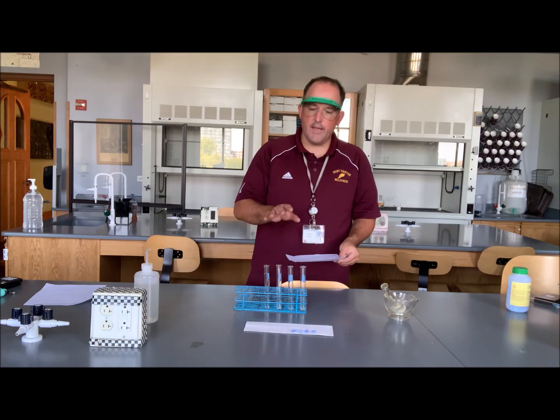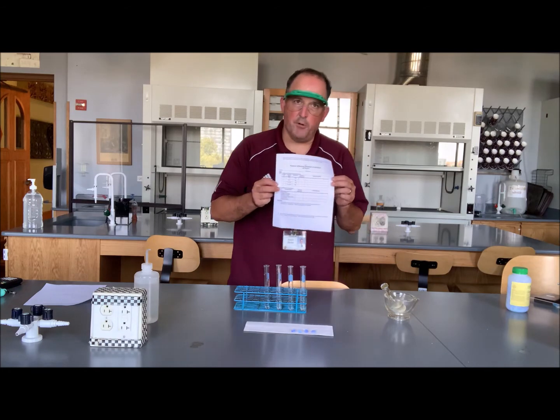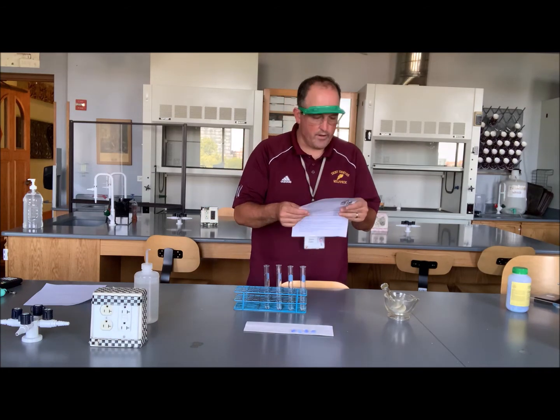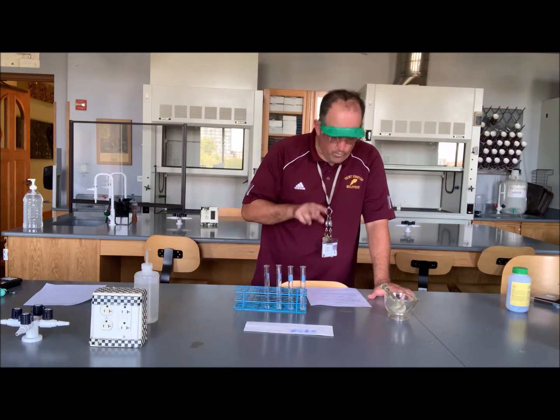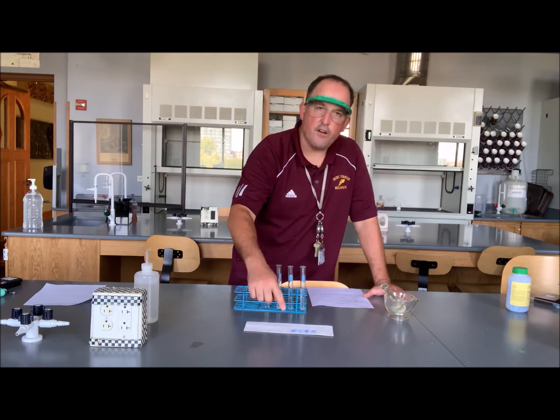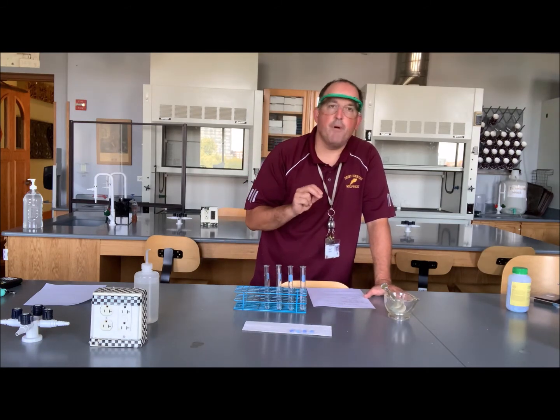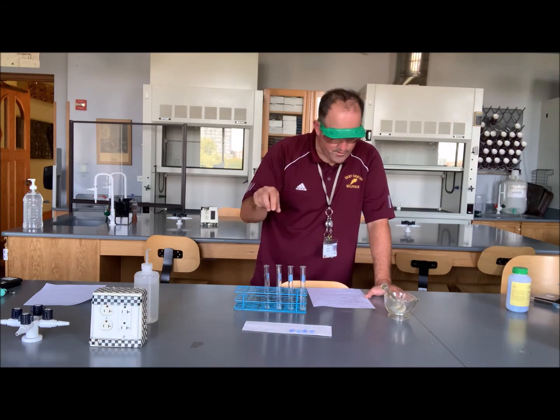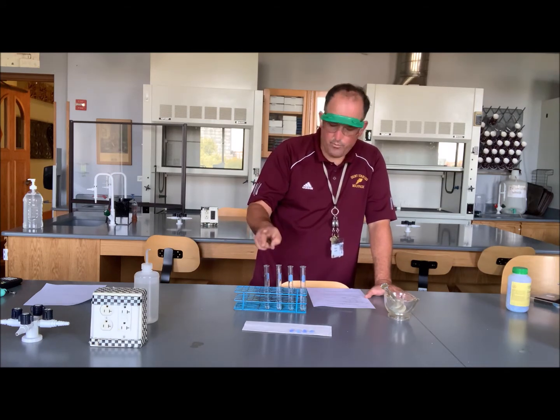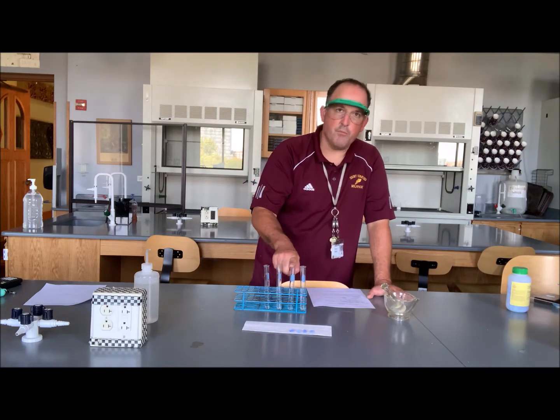And we're going to treat each of the 4 test tubes differently. It's probably best summarized in the data table. So if you have access to the data table, go ahead and take a look at it. Of the 4 test tubes, 2 of them will have a full-sized crystal of copper 2 sulfate. The other 2 will have a crushed up particle of copper 2 sulfate. Then, between the first 2 test tubes where you have full-size particles, we're going to swirl test tube number 1, and we're going to swirl, of the 2 crushed particles, test tube number 3.